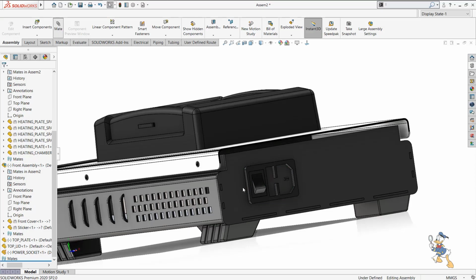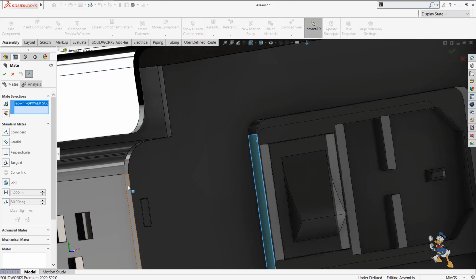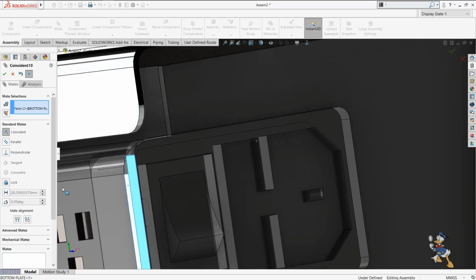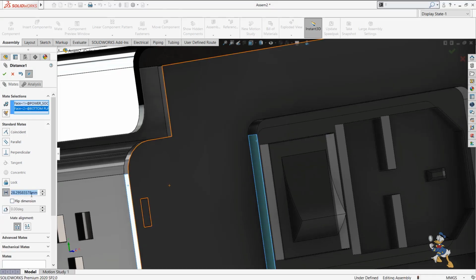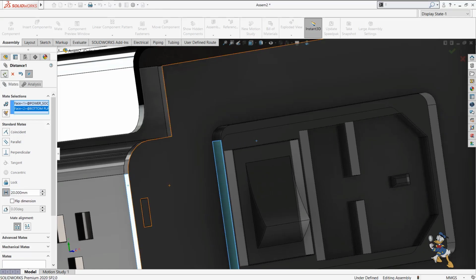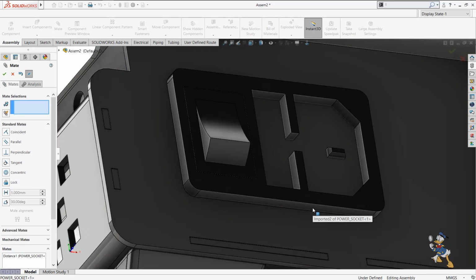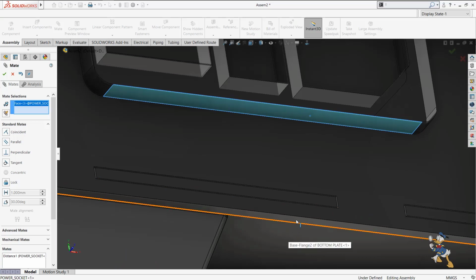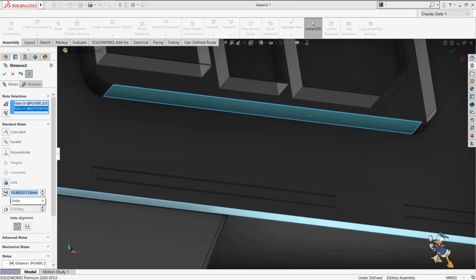Some more mates are required because it is a smart component. I'm just showing you one more facility available in SolidWorks, which is the smart component facility. It is also a competitive facility, which some other tools might be providing. I don't know if any other one is providing it right now, because SolidWorks itself is the tool which is providing the smart component facility right now. So just need to check out the value.